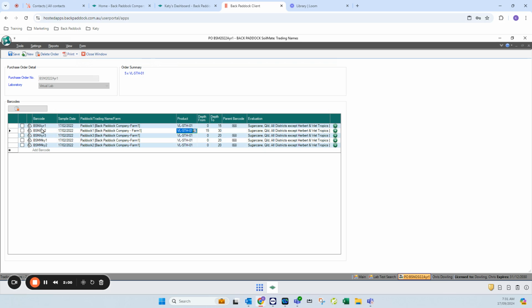Okay, so I can now see that both of my two barcodes here have been assigned to the same paddock, and I should now be able to use my drop down to select the correct parent barcode. All right, so at this stage here, I've made modifications to these two samples. I've changed their depths. I've correctly reassigned the paddock for this second sample, and now I'm going to save my order and click yes.